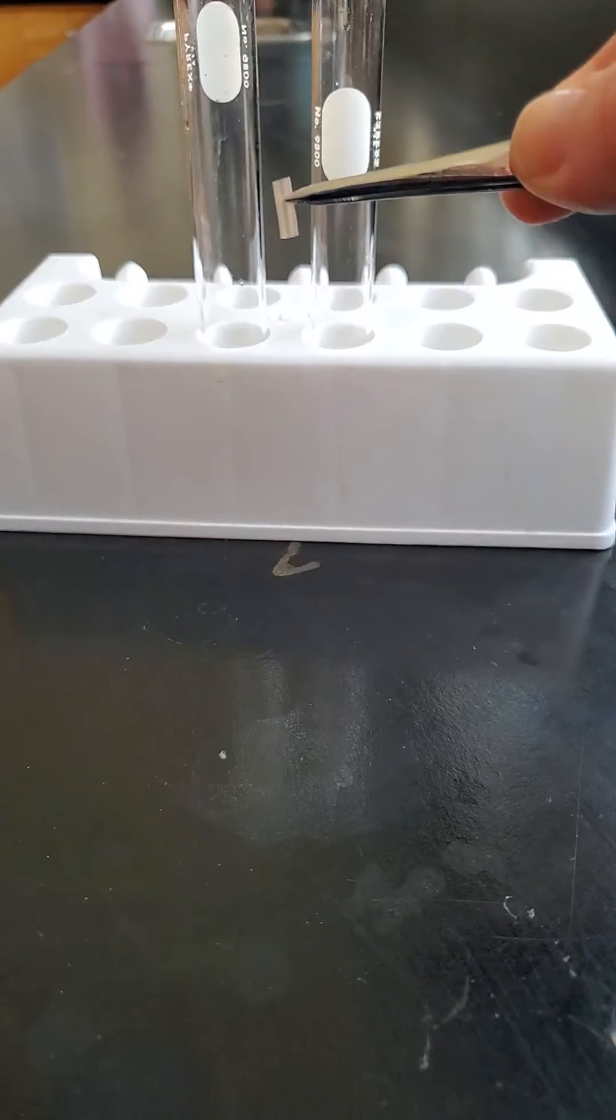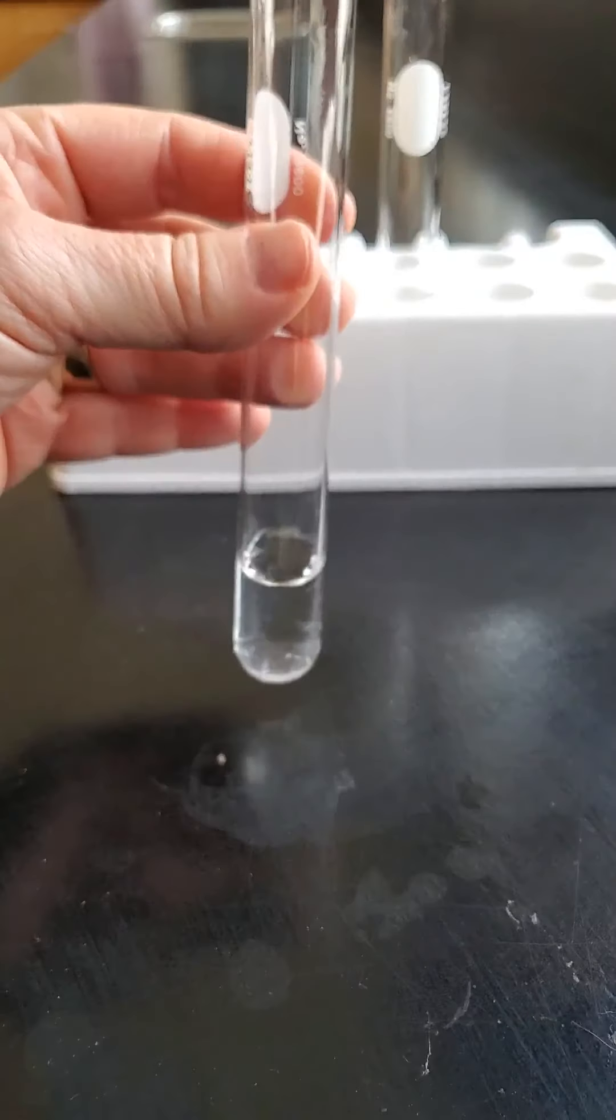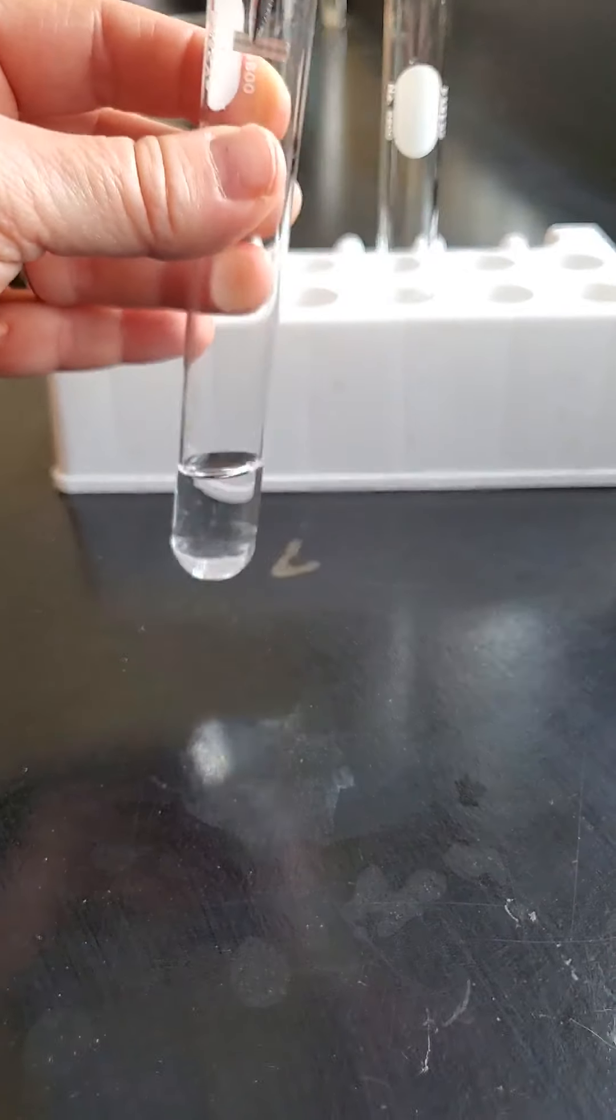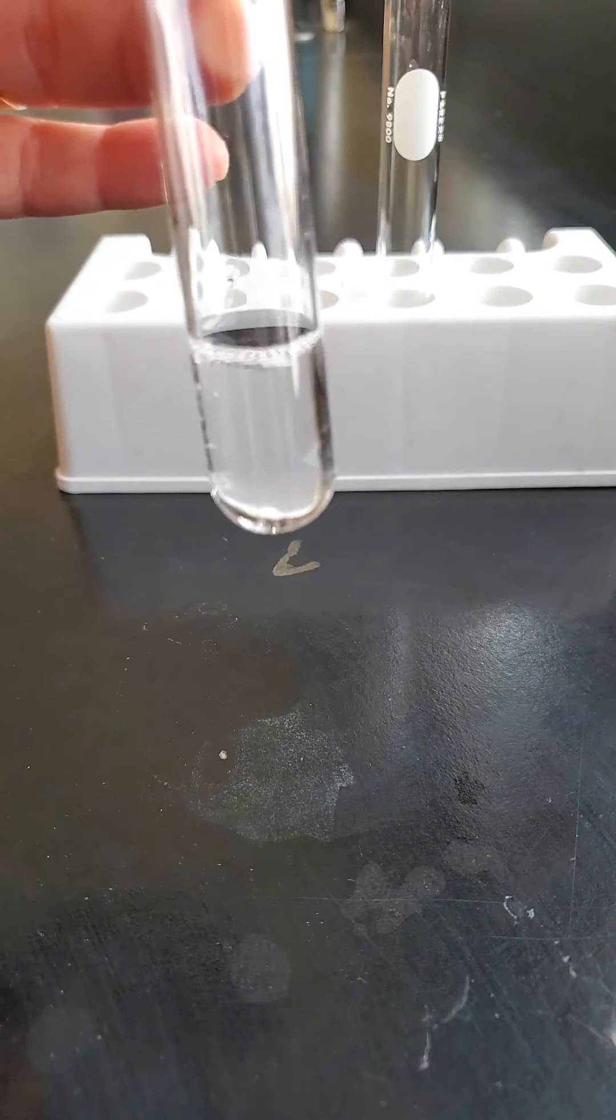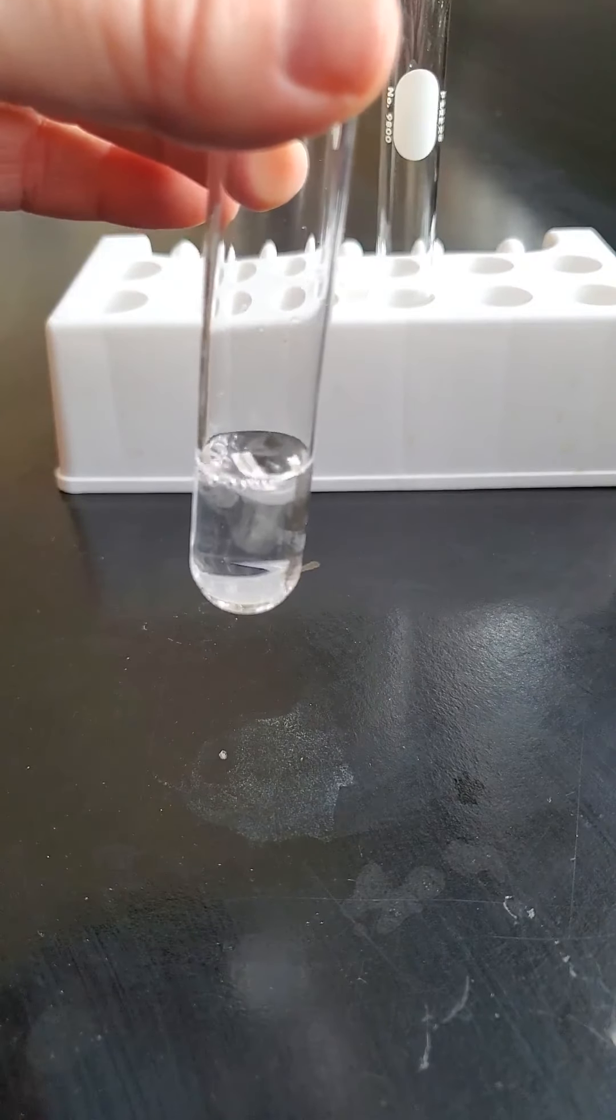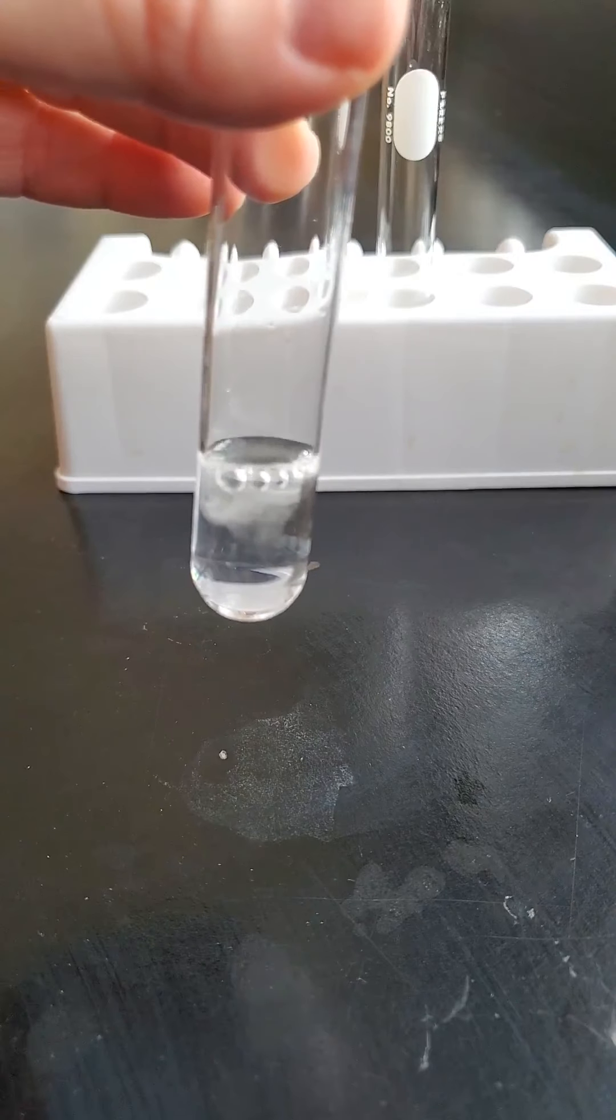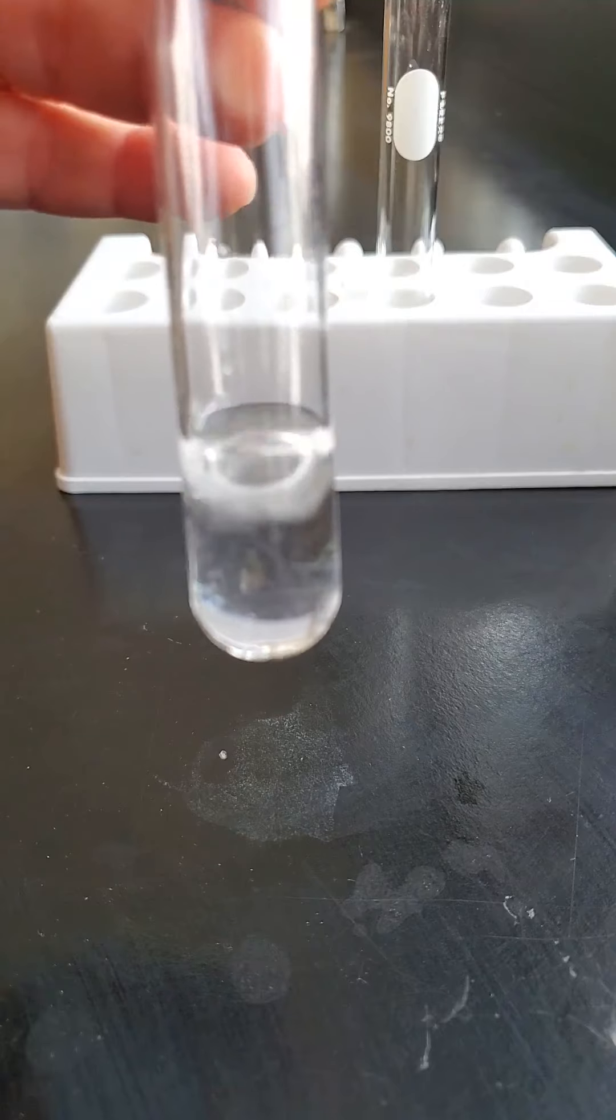I've got one piece here. Here's my hydrochloric acid. Let's see what happens when we drop that in there. Look at that! Bubbles forming, it's dancing around on the surface. You can hear it.